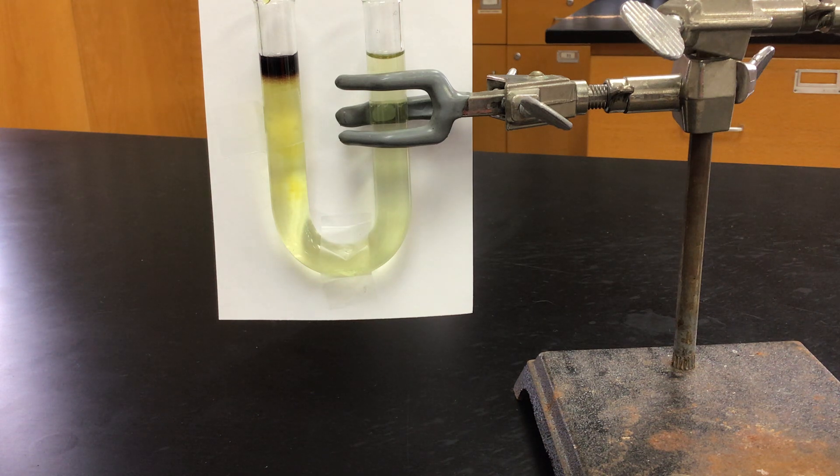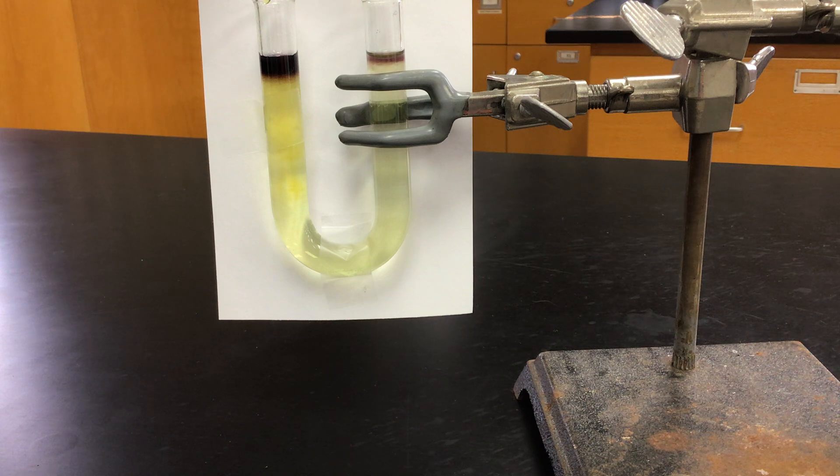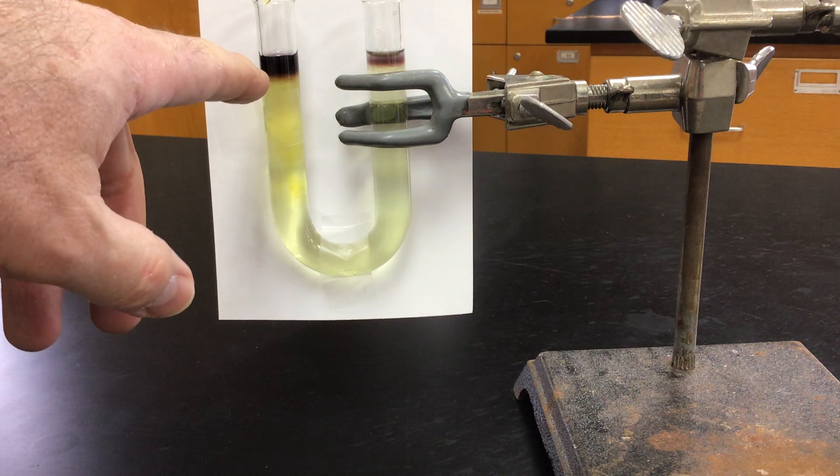If you're kind of wondering if we made some on the other side, unless some traveled over there, we really shouldn't have that. Maybe a slight amount with potassium iodide reacting. Not quite sure, but definitely we made a bunch of iodine here. Maybe some of it already traveled.